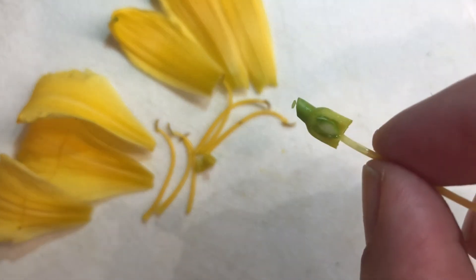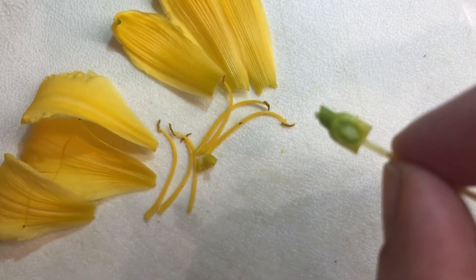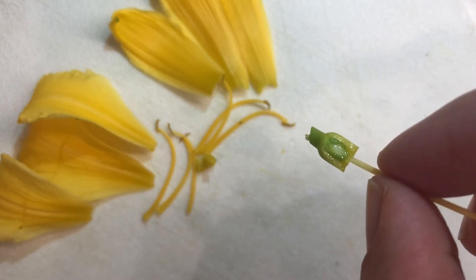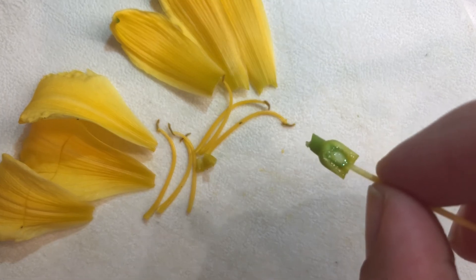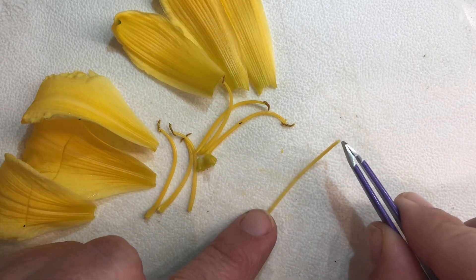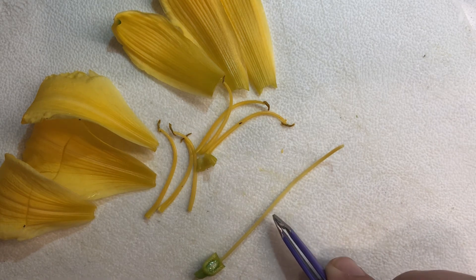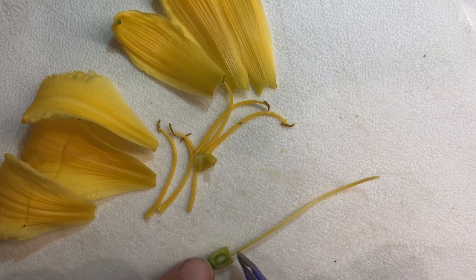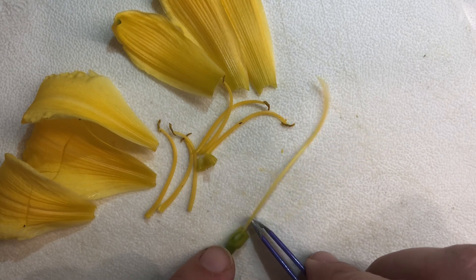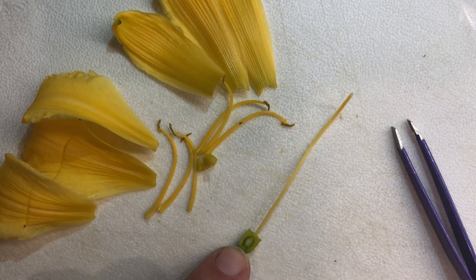This green part at the base is the ovary. If you see the white inside the ovary, that's where the ovules are, and that's where the eggs are going to be. So if this flower is pollinated, the pollen from an anther would land on the stigma, grow a long tube all the way down the style into the ovary, and then pollinate the egg which is inside the ovule. The pollinated ovule becomes a seed, and the ovary is what swells up to become a fruit.